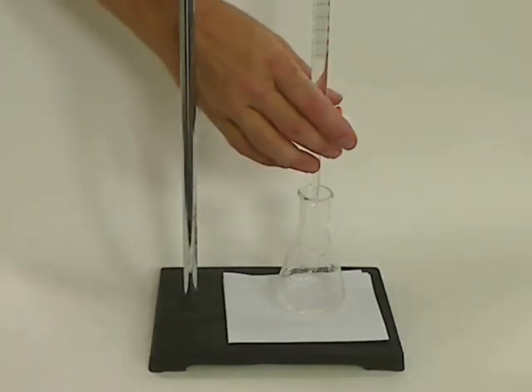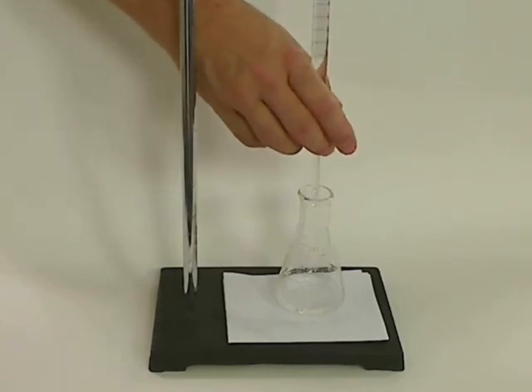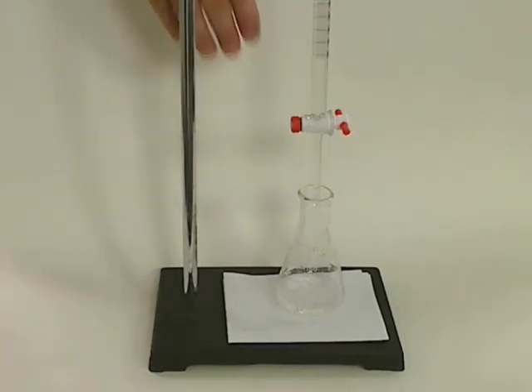Practice doing a titration just using water to make sure we get all the air bubbles out, how to get one drop, and how to read the meniscus. These are all things you want to do before you start your actual titration.